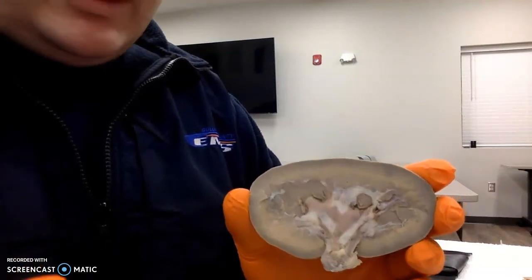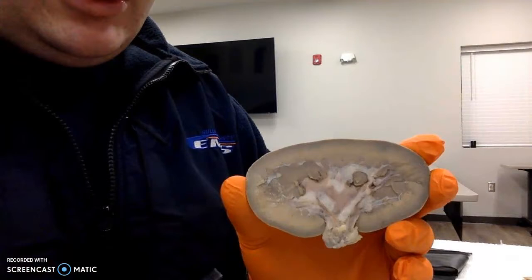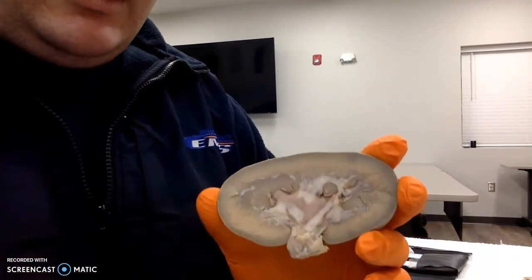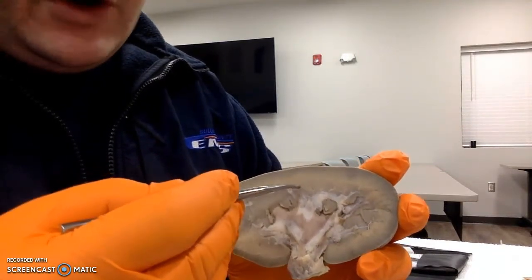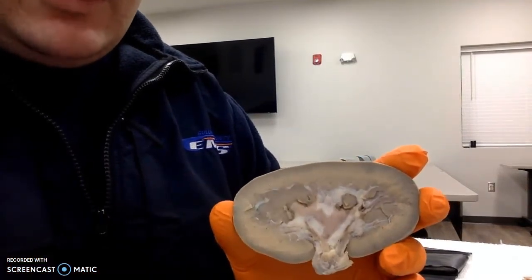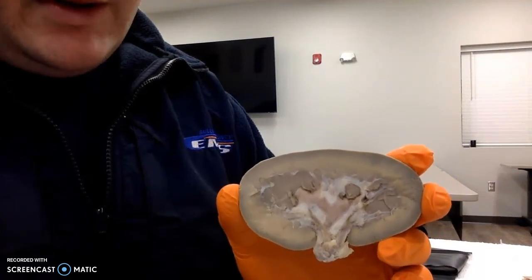I was interested to see just how dense and tightly packed this tissue is, and it's really interesting to think about the process of the blood coming in and the filtration, and where exactly we have these nephrons, where the capsules are and how they extend down into the medulla. It really helps cement what we studied in the textbook with a visual example of it.